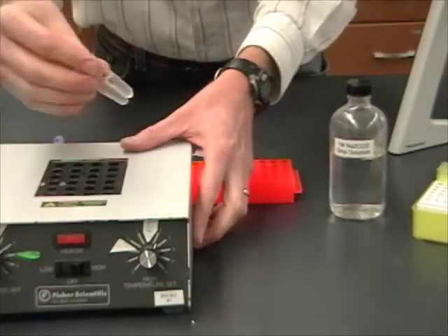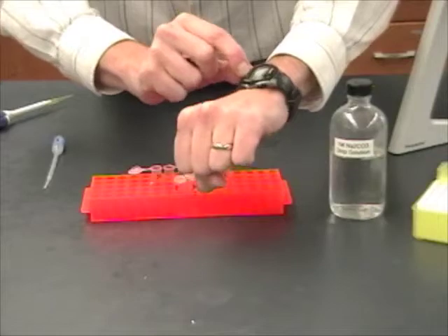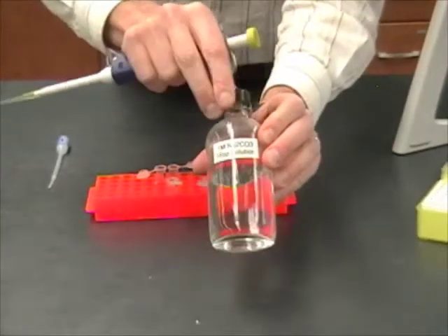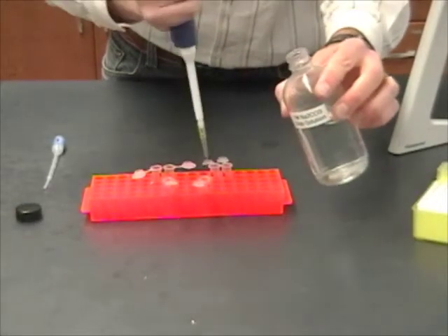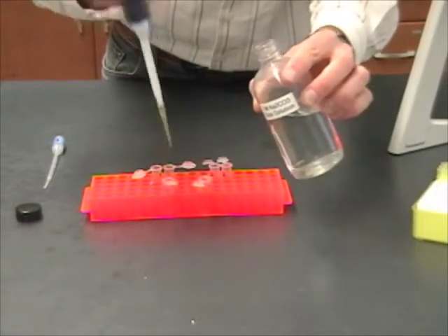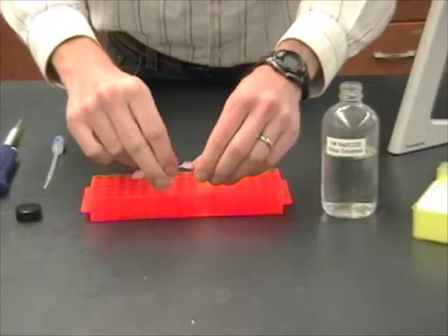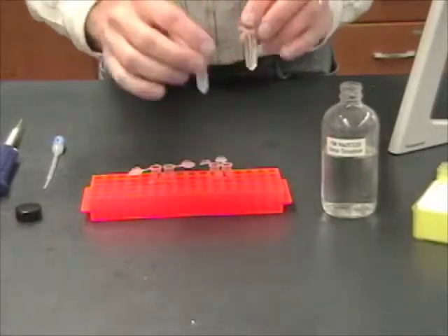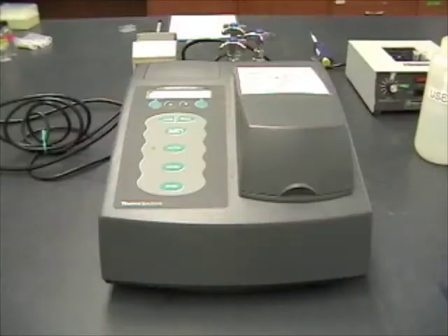Now, as soon as you do, let's say I pulled mine out and I noticed a little bit of yellow in here. I've got to stop that reaction quickly. The other thing I need to do is look at the time. So, I'm going to stop my stopwatch and record that time. And now, I'm going to add 200 or 400 microliters of the sodium carbonate, the stop solution. That will stop the enzyme reaction from happening. So, there's 200, 400. This is denaturing the beta-galactosidase enzyme and preventing this reaction from continuing. 200, 400. I add it to both the tube C and tube B, the blank, because we want to treat them the same way. Now, once these have been mixed, then I can relax a little bit. These can be set aside and they won't change anymore until I'm ready to later observe them in the spectrophotometer.